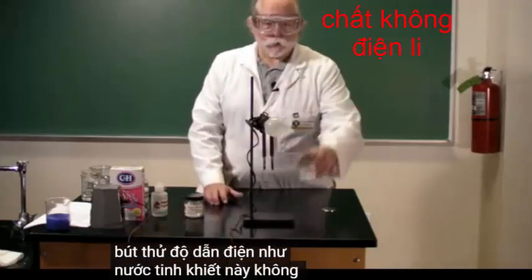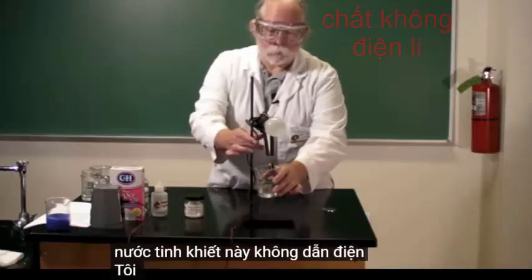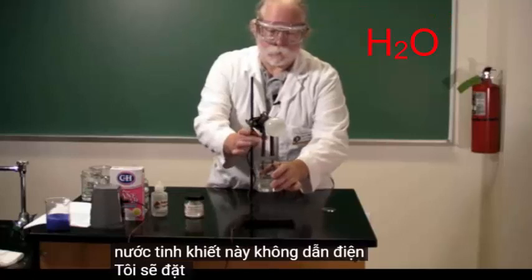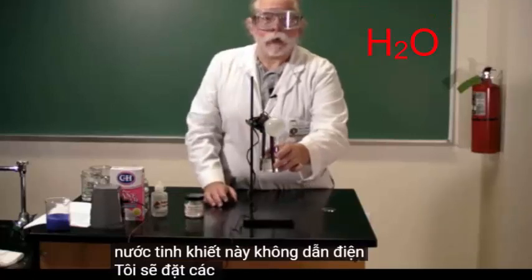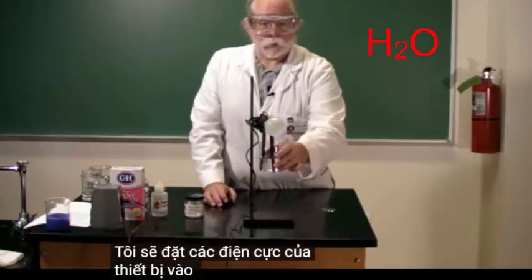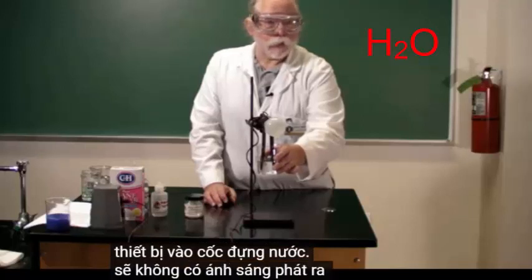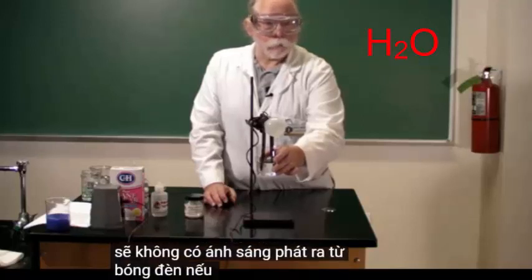Pure water does not conduct electricity. I will put the electrodes of the apparatus into the beaker of water — there's no light coming from the light bulb.